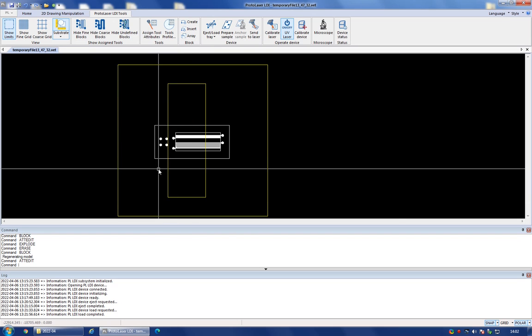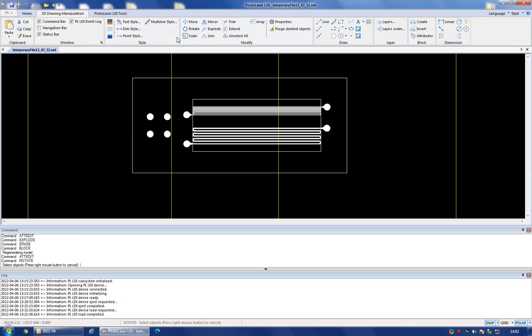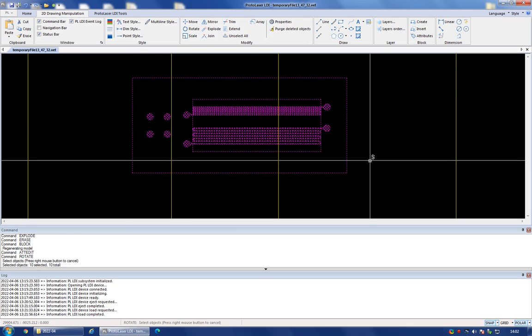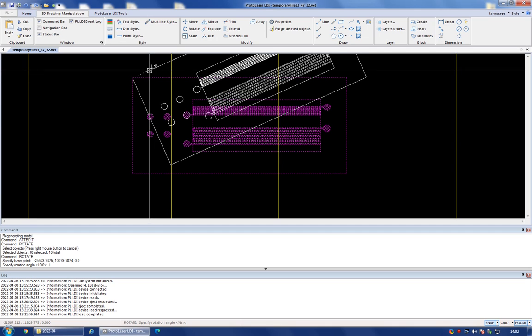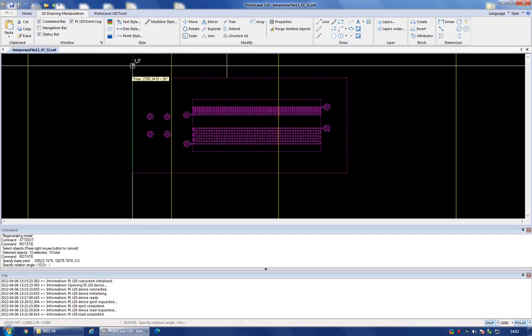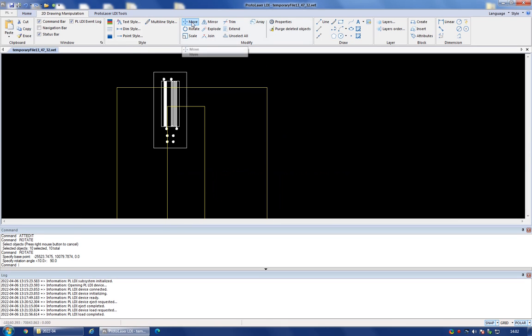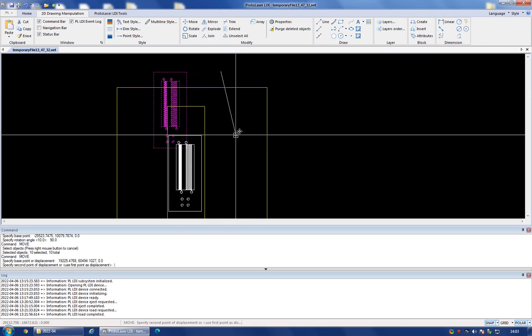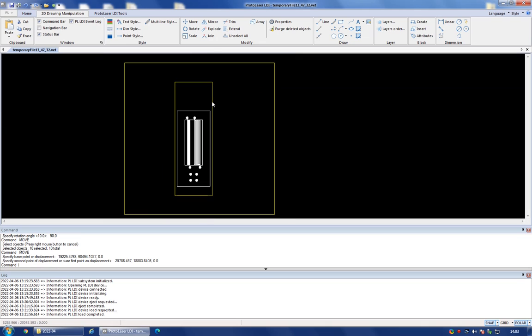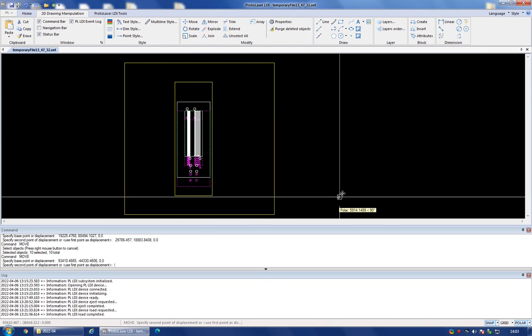So what I need to do next is to go in my drawing manipulation, select the whole structure, right click, and then rotate it by 90 degrees. I can again do this just graphically, and here is my structure. Now I want to move it, so I select it all, and I move it roughly in the center of the glass slide. Okay, it's not really in the center, so I'm going to reposition it slightly, roughly there.